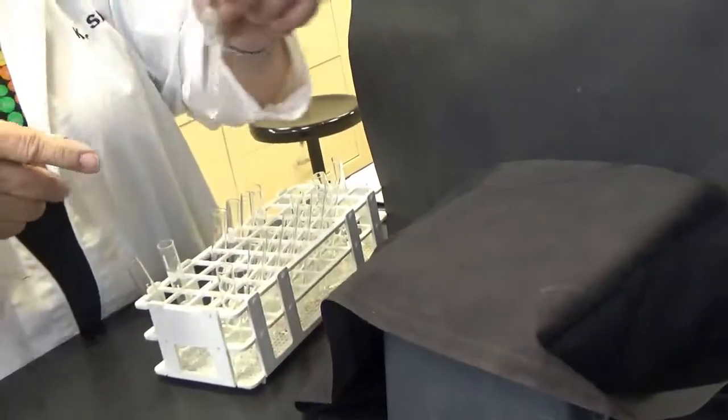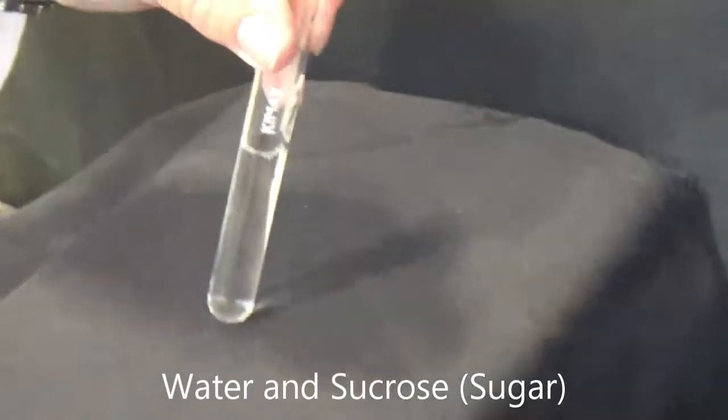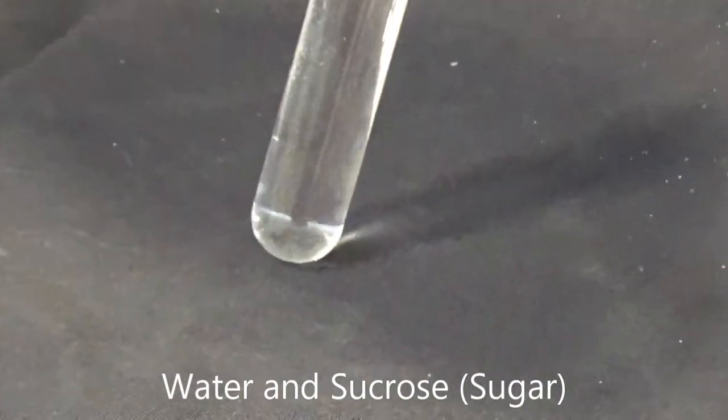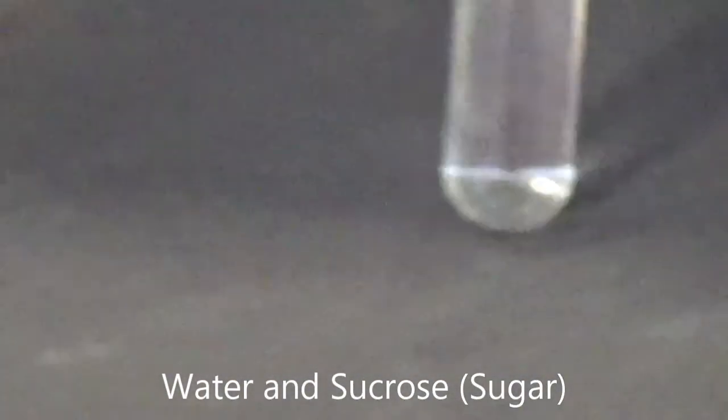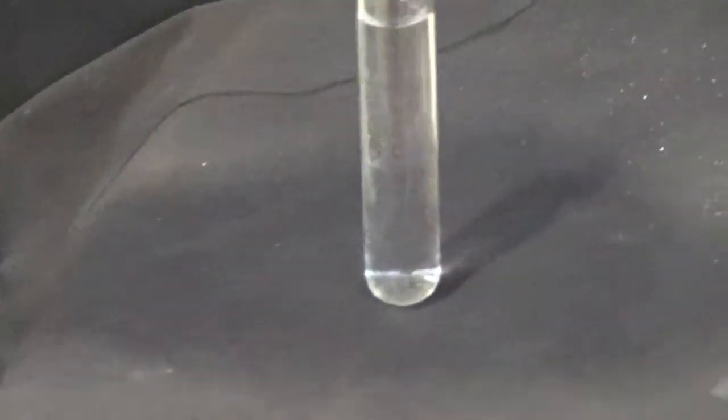Okay, our next one is I mixed a little bit of sugar, sucrose, with some water, and again, same question as before. Where would you expect to see the sugar or the sucrose? Would you see it on the bottom or somehow sitting in the water? Do you see any of the solid?